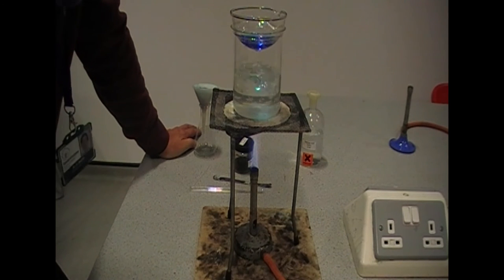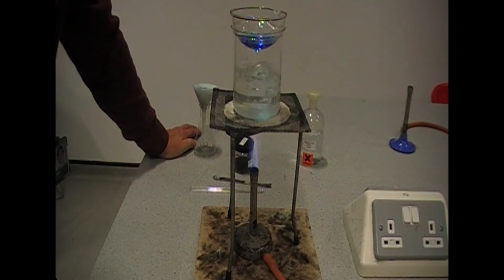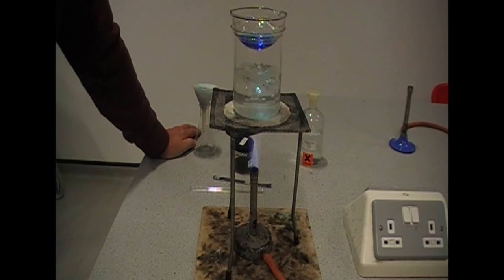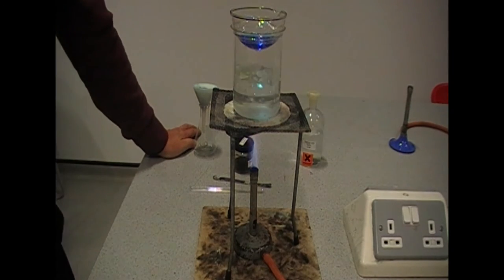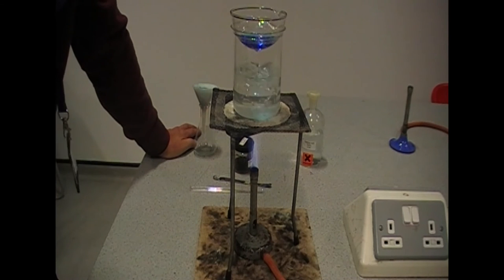We've been heating this for a while and we've reduced the volume by about half. I hope you can see that okay. So now, as per the instructions, we are going to take that and put it on a cool windowsill and leave it to evaporate.